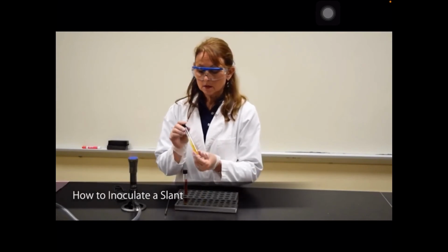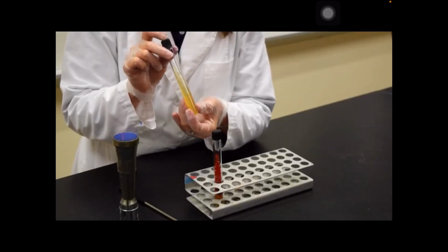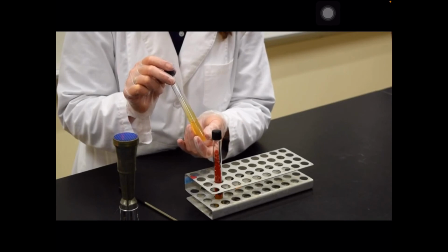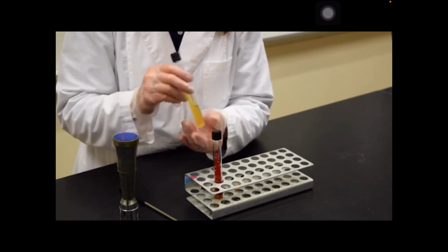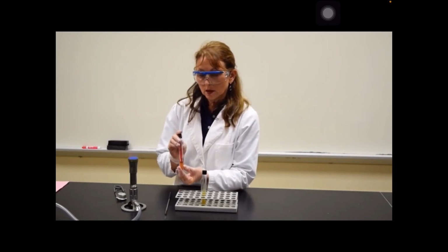This demonstration is to show you how to inoculate a slant. A slant is culture media that contains agar that's placed in a tube that has a screw cap. The liquid culture media is autoclaved. When it comes out of the autoclave, it's placed on boards so that it solidifies and we have a slanted surface. I'm going to be inoculating the slant with bacteria that I have in another slant.